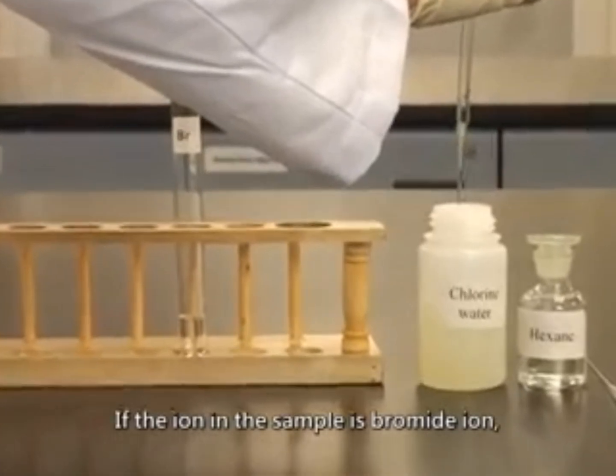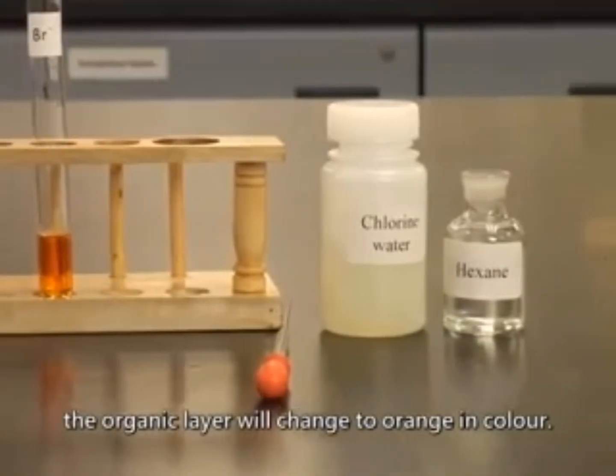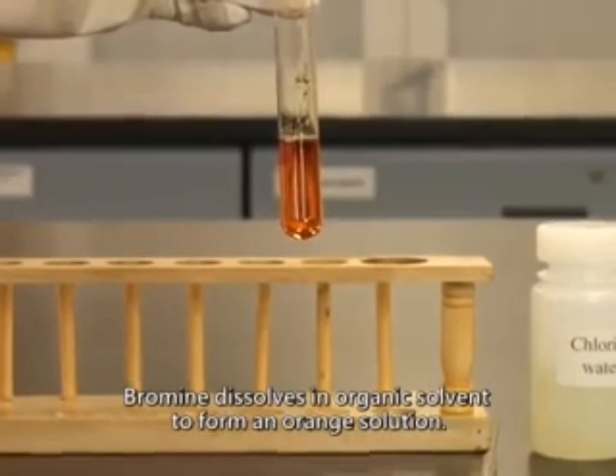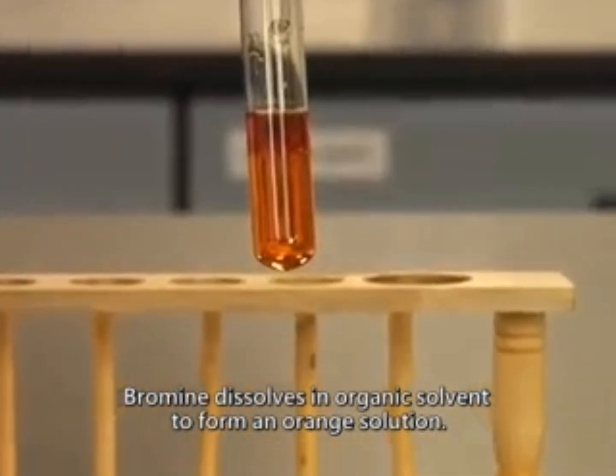If the ion in the sample is bromide ion, the organic layer will change to orange in color. It is because the bromide ion is oxidized to bromine by the chlorine water. Bromine dissolves in organic solvent to form an orange solution.